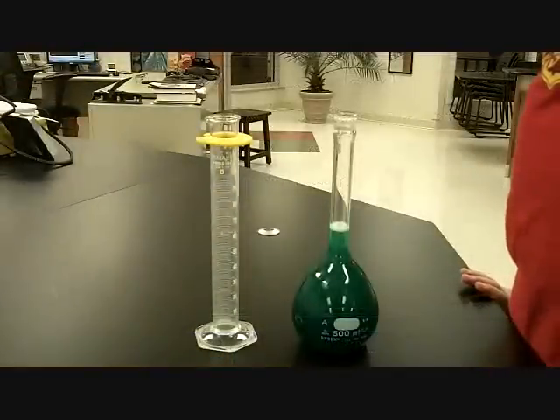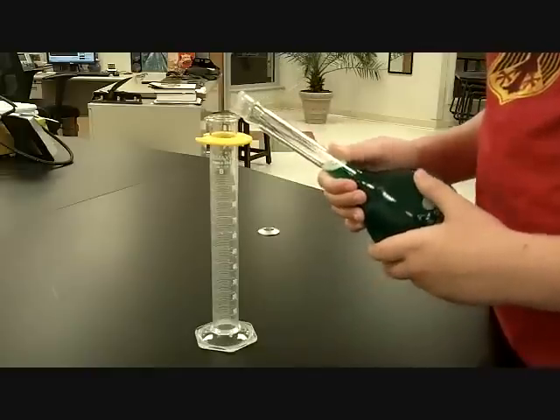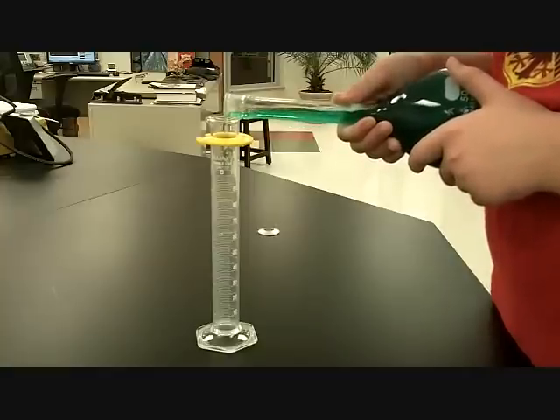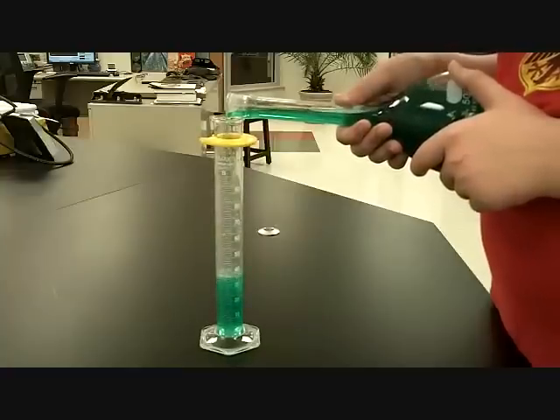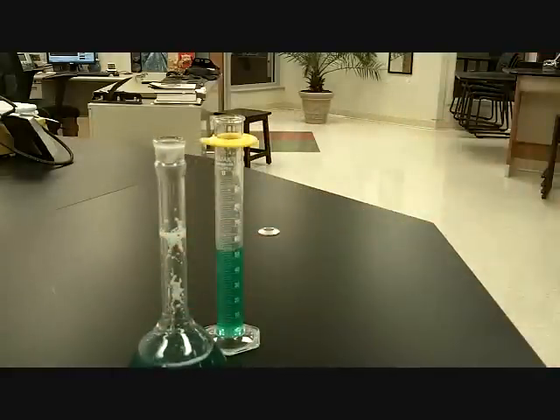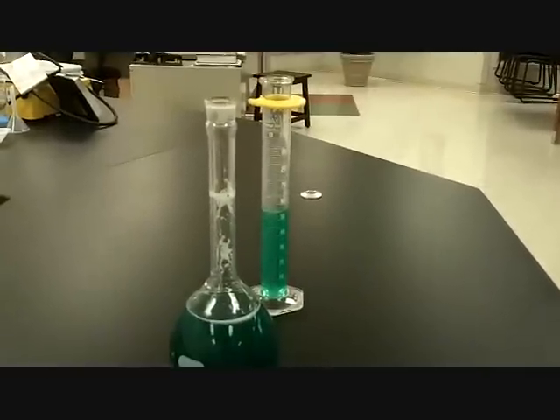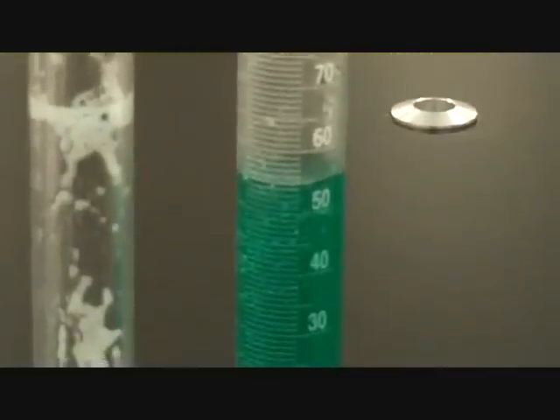Samuel, we're going to need 54 milliliters of this. Could you please measure out 54 milliliters of it? And be careful here. Take your time. This is not a hurry or a rush. You're about 20, 30, 40, 50. Slow it down. Whoa! That is either good or beginner's luck by all stretch of the imagination. That is ridiculous. 54 milliliters. Fantastic.